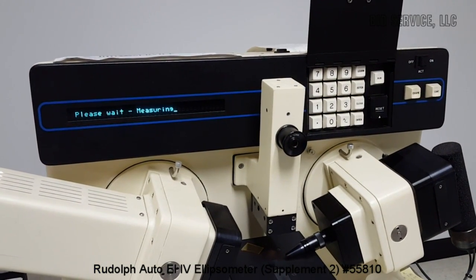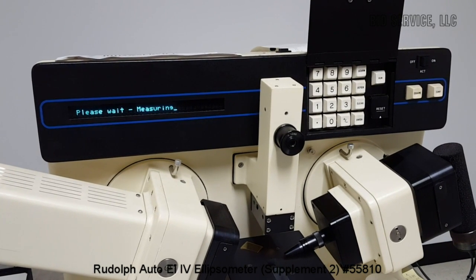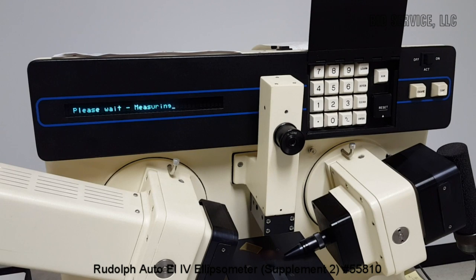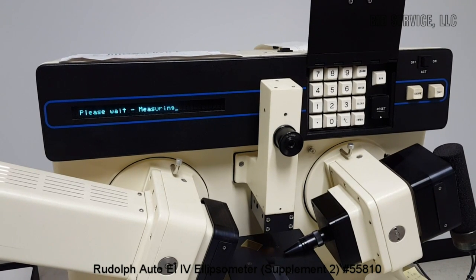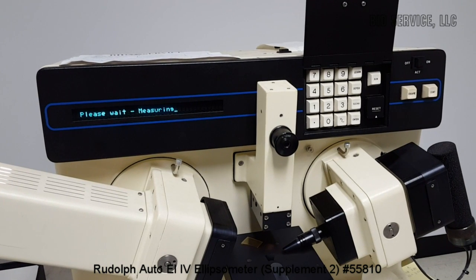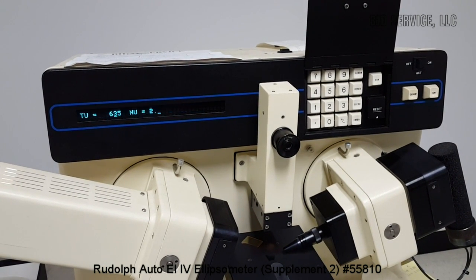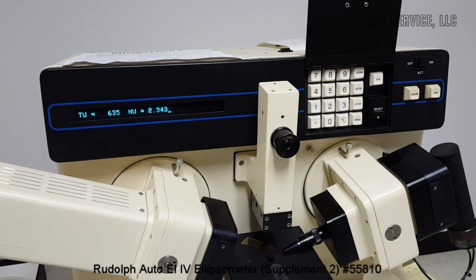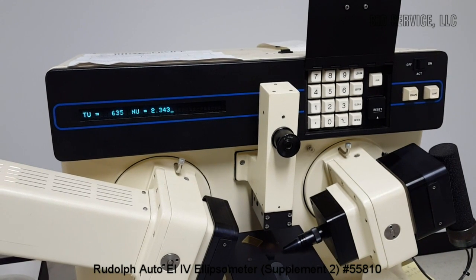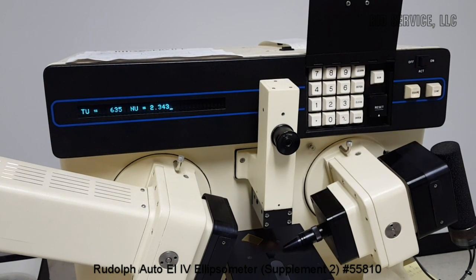There are general use program numbers available, 10 to 19. They can be accessed using the password 3740, and we can enter any desired programs there as well. And 20 to 35 program numbers are pre-programmed files, and which are explained in the manual here.